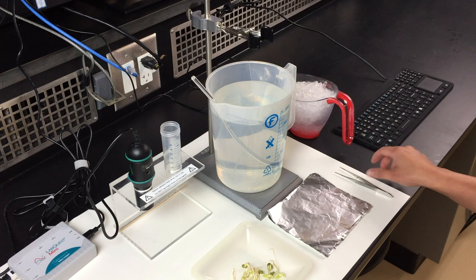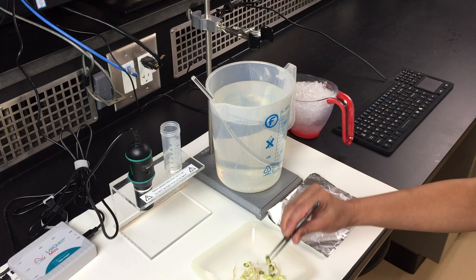When you handle the mung beans, make sure that you handle them gently with the blunt forceps and handle them by the cotyledon.